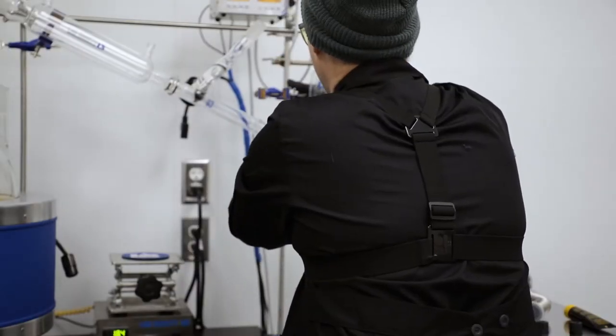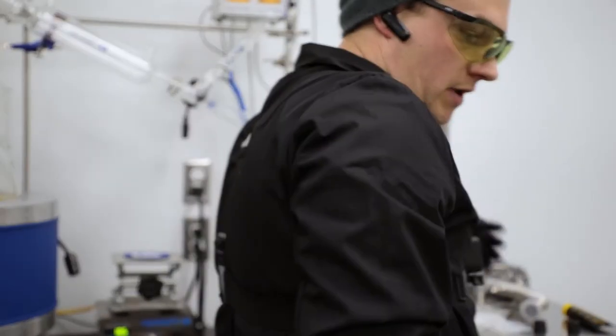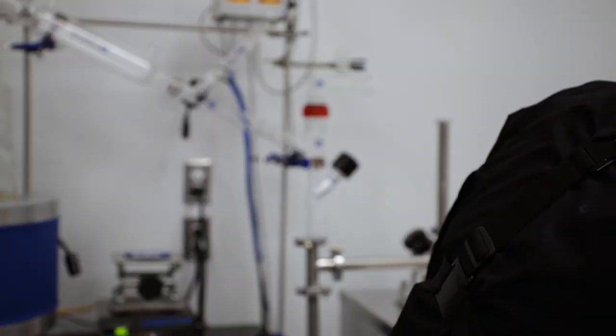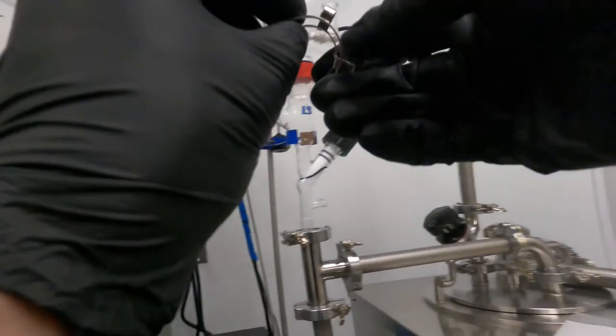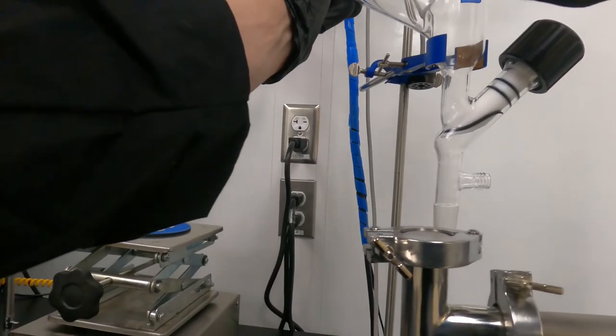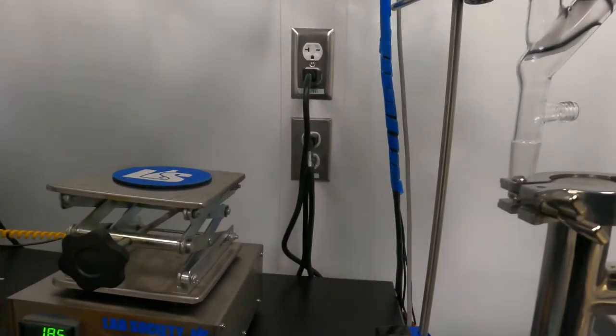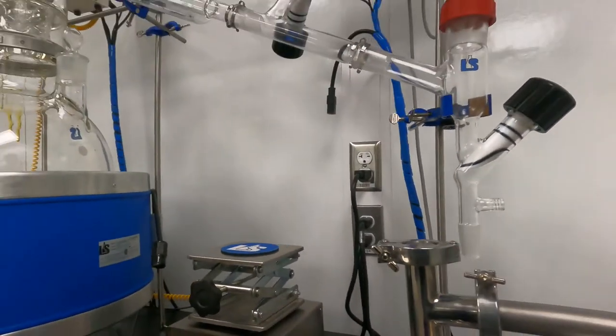So now I'm going to go ahead and clamp this in place. Make sure I get my keck clip on there. Typically I like to make sure my keck clips are installed on the glassware before doing anything else. Leaving glassware that's not under vacuum without keck clips installed may jeopardize the glassware if something were to fall.